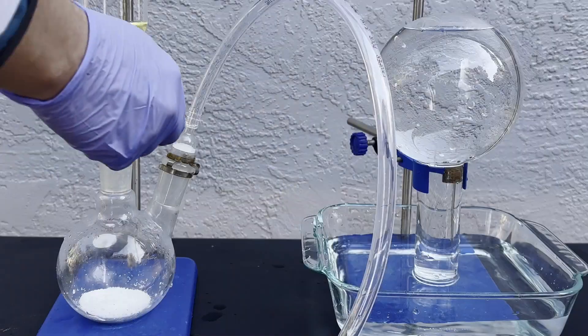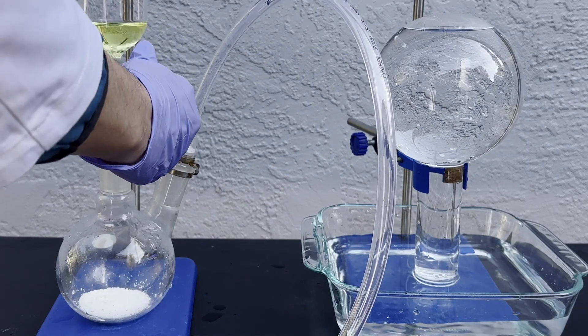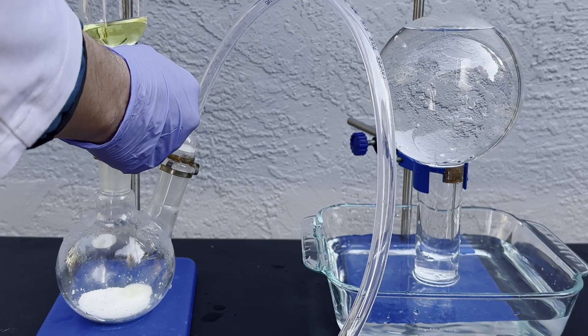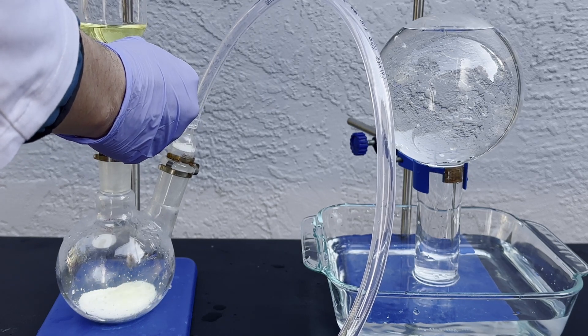The element chlorine has some similar properties to oxygen, but it's also much more reactive. I've shown how to make table salt with it in a previous video, so I'll prepare a flask full of chlorine to see what acetylene does in it.